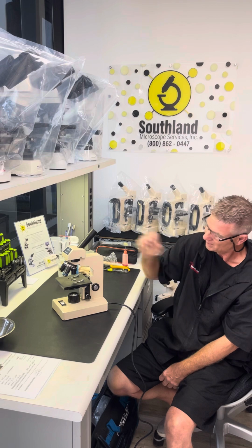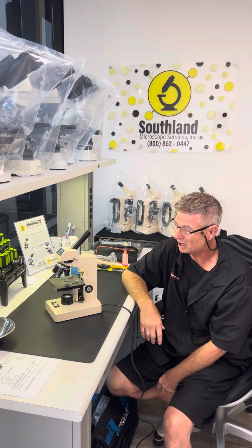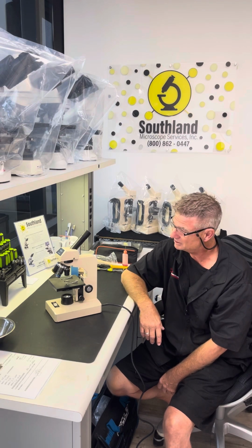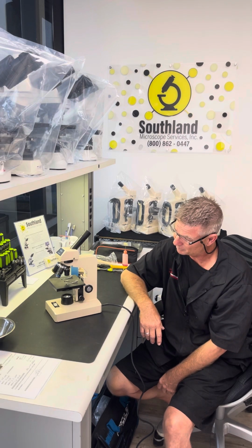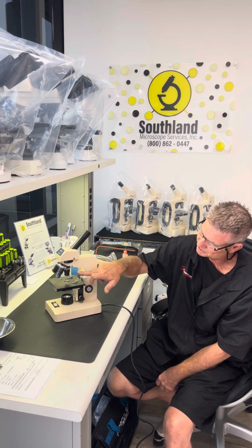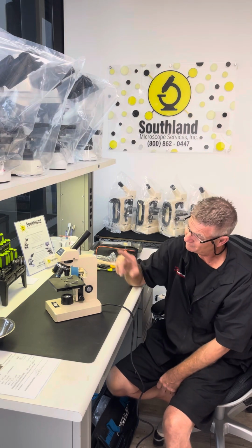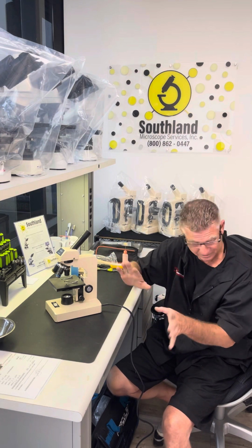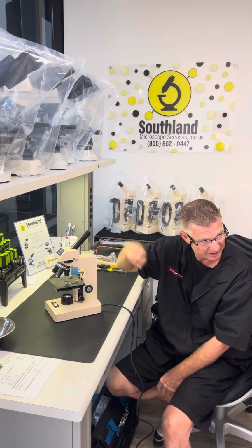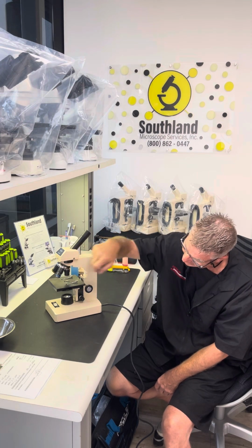Let's move on. The microscope, the Swift M2251. This is the educational model microscope, for high school, middle schools, simple basic education. There are 3 components in a microscope we want to pay attention to. You have the optics, which are the glass lenses, which are configured at different angles and convex and all that stuff, to be able to get what we're looking at bigger. So you have optics, which are the glass that light passes through.